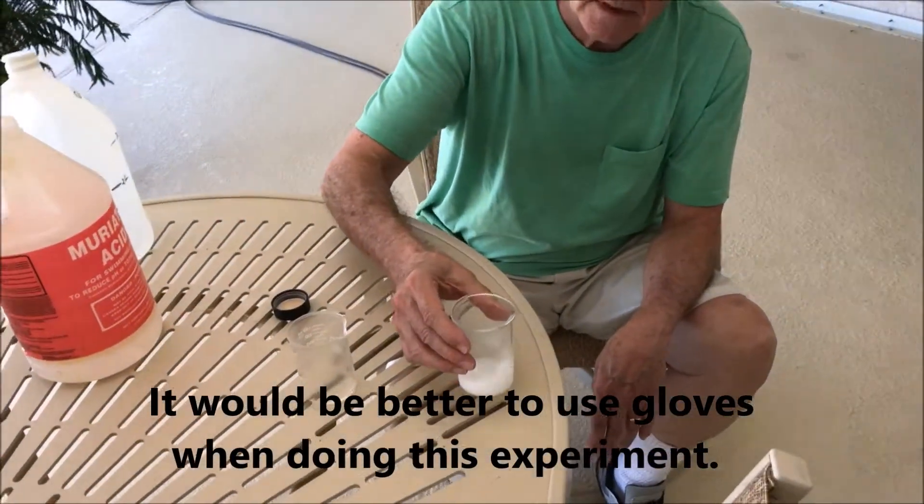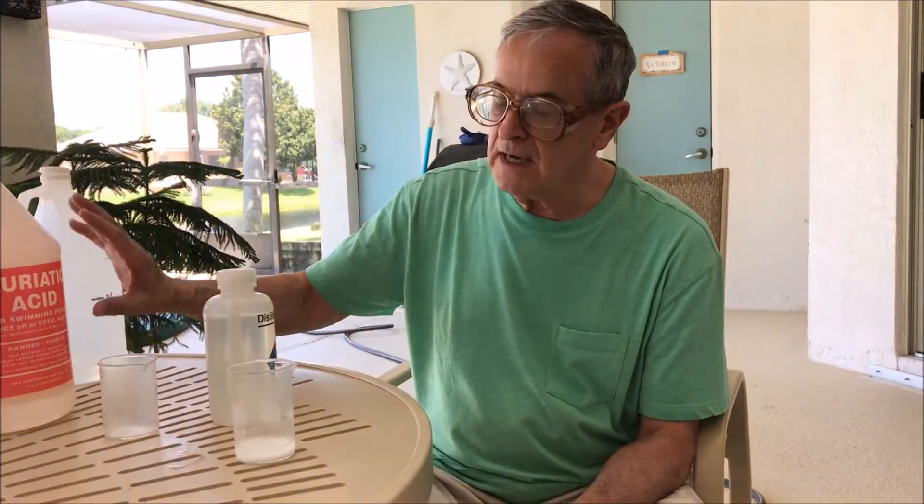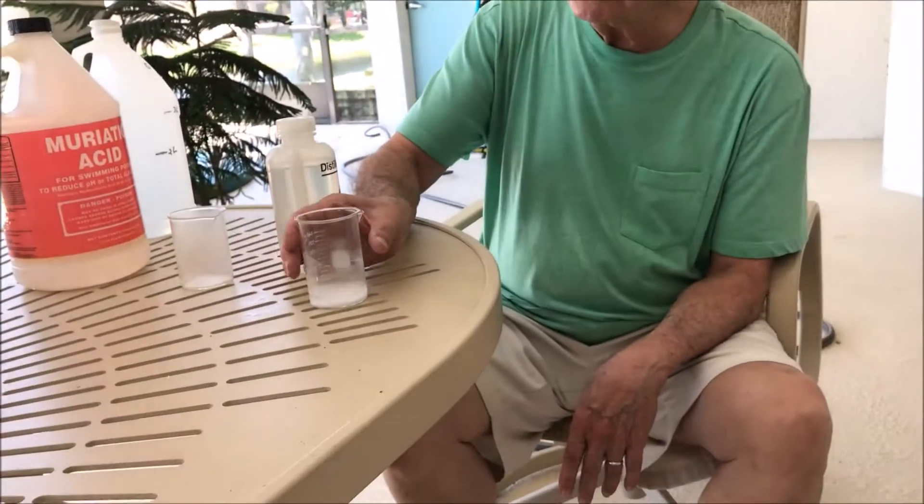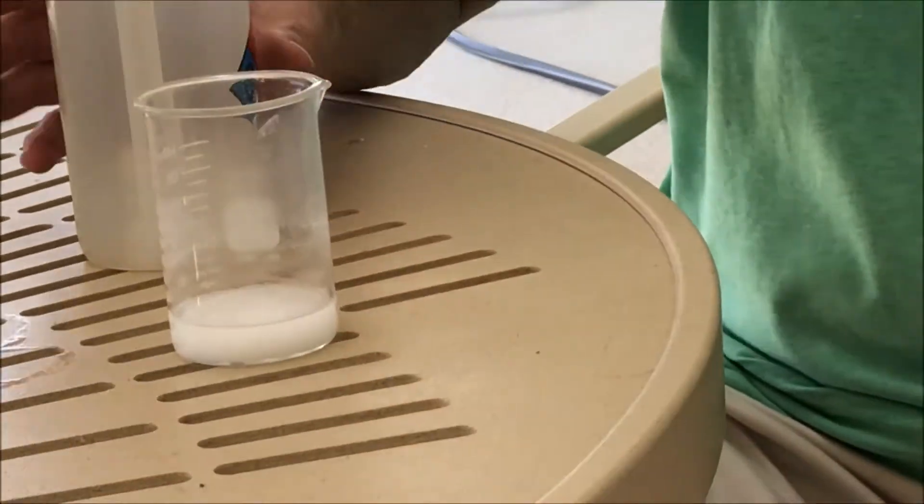It seems like the reaction has stopped. I've added the concentrated hydrochloric acid to the sodium bicarbonate and it stopped fizzing, so the reaction seems complete. I do have some white at the bottom.